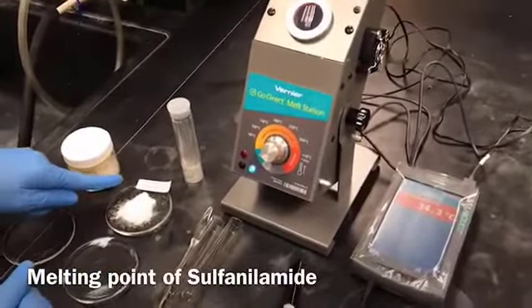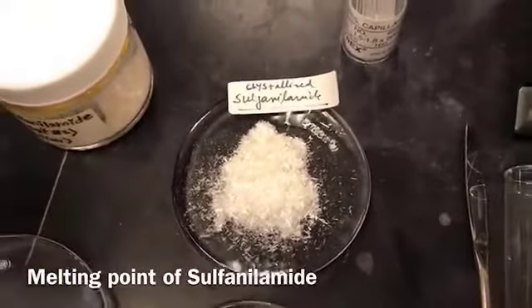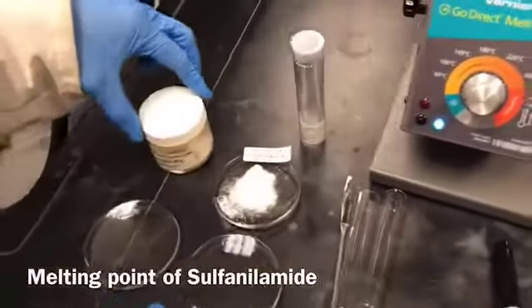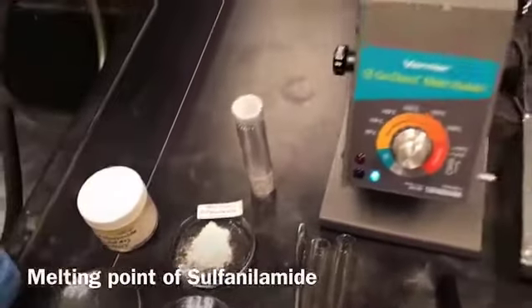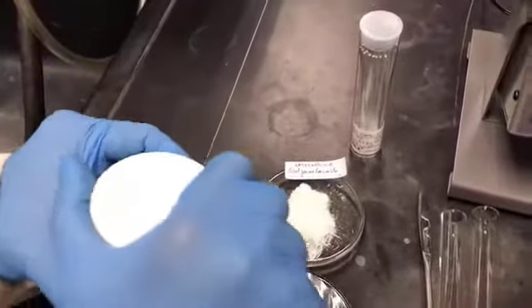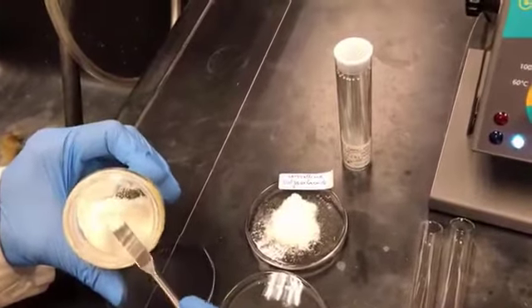So we already crystallized our sulfanilamide, but how can we say that it is pure? We need to analyze it by taking the melting point. So we are basically going to take the melting point of impure sulfanilamide as well as the crystallized sulfanilamide. So let's see how you can do it. Now I am going to take out a little bit of impure sulfanilamide onto a watch glass.